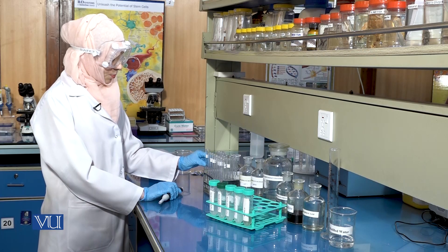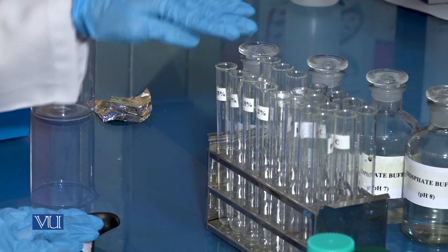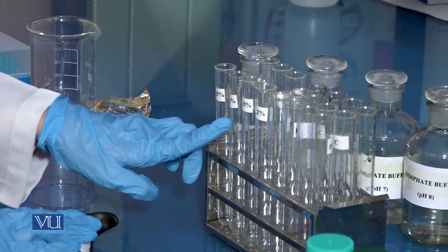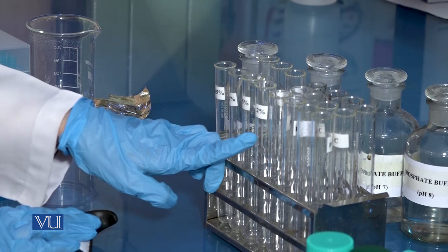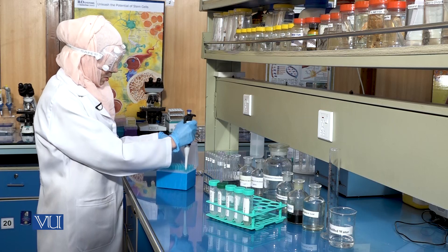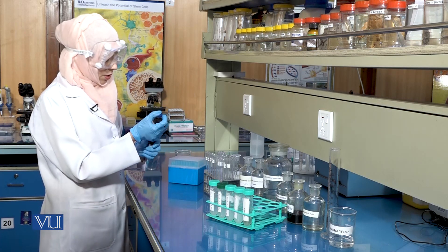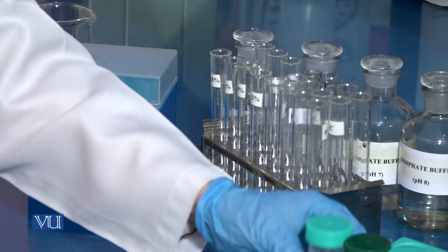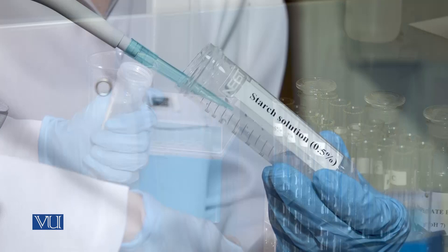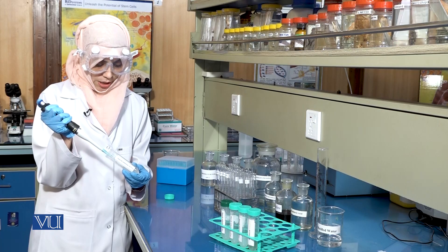To proceed with the experiment, we will take four test tubes and label them according to the starch concentration: 0.5 percent, 1 percent, 1.5 percent and 2 percent. Next, we will transfer 2 ml of the starch solution to each test tube.